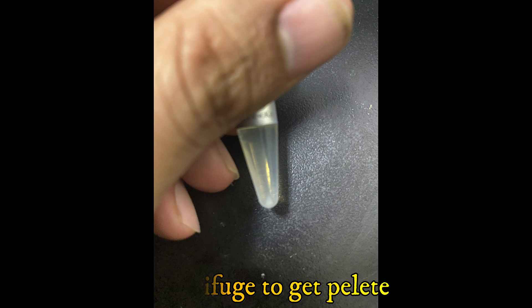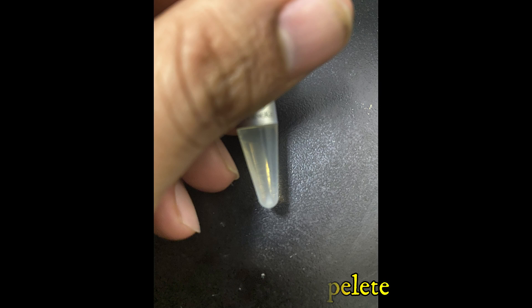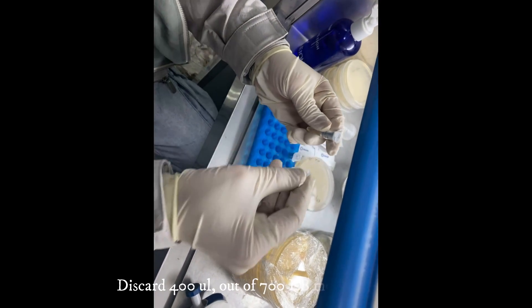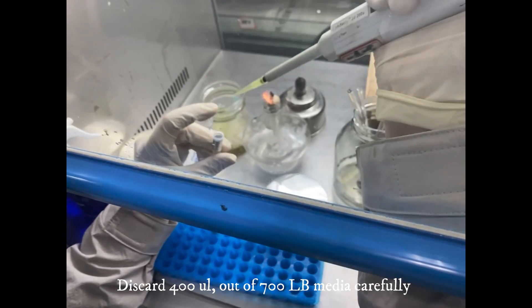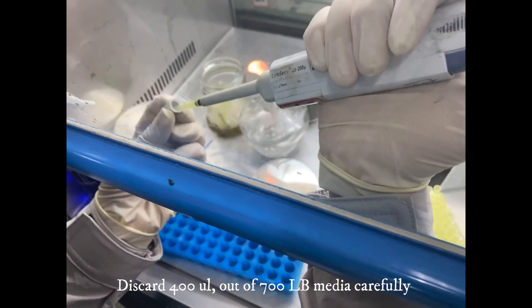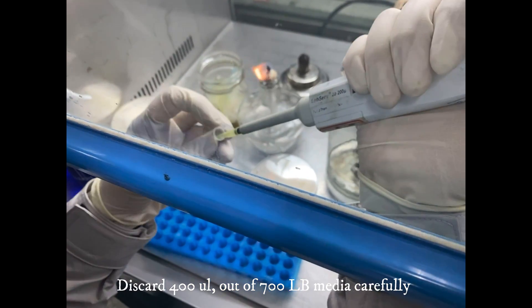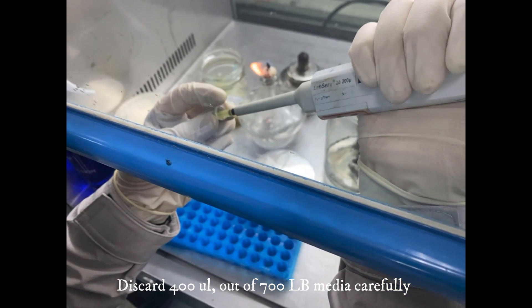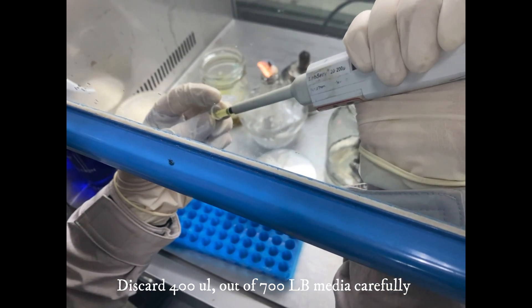Here the pellet is visible at the bottom. We should remove and discard the supernatant, and the remaining 300µL of LB media containing PCR product and DH5 alpha can be spread onto petri dishes.